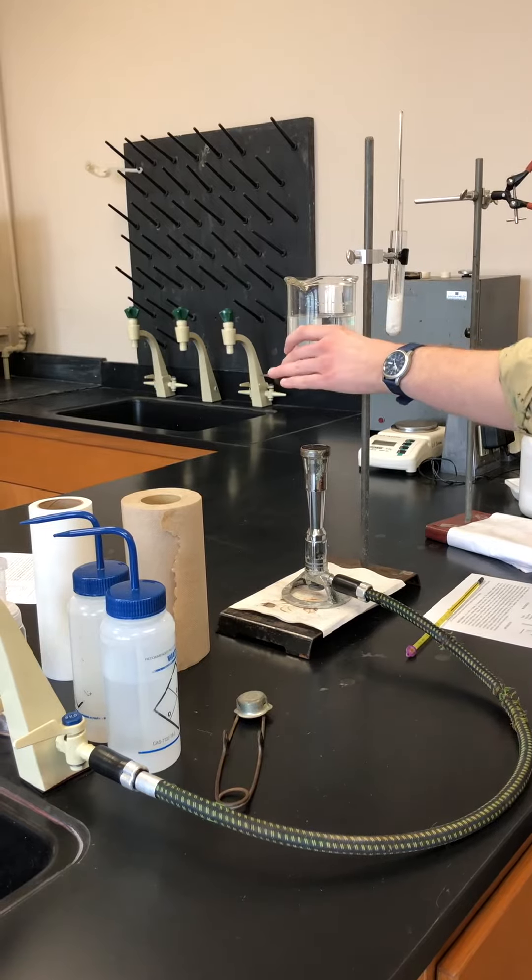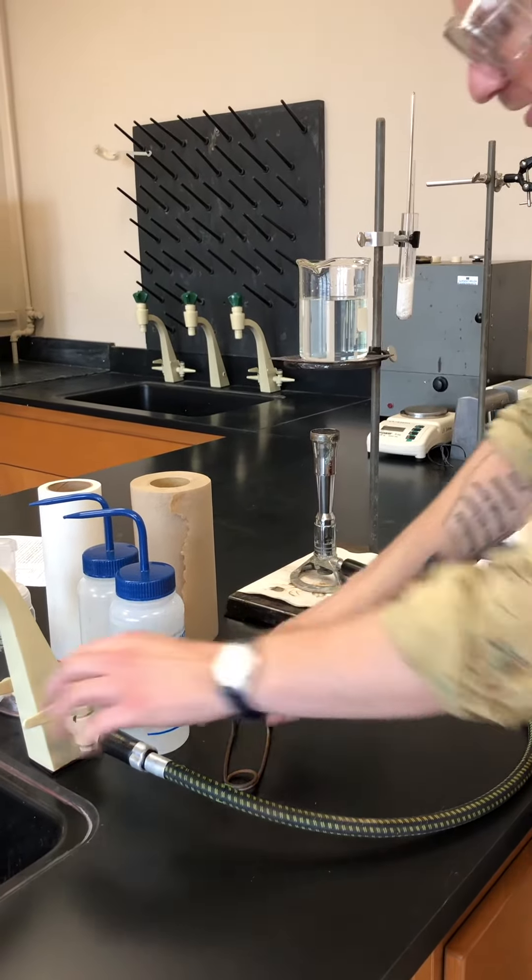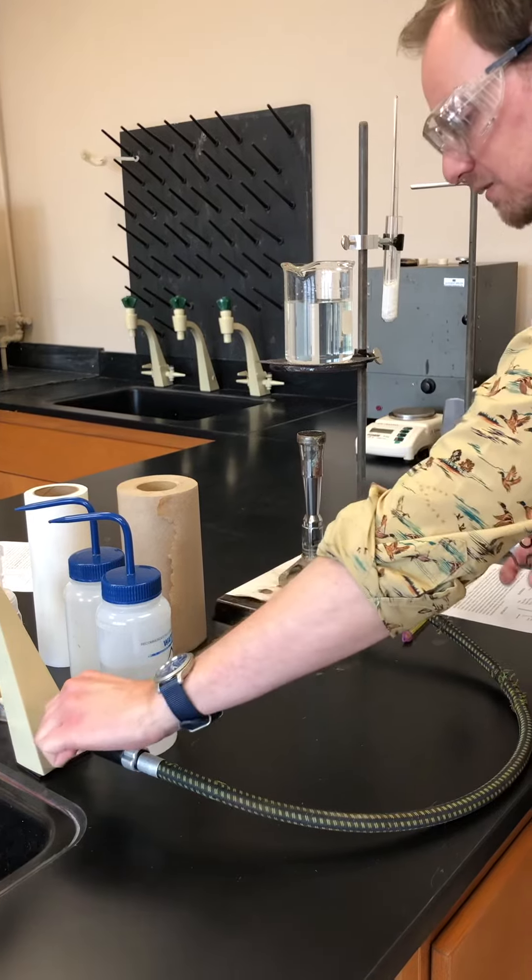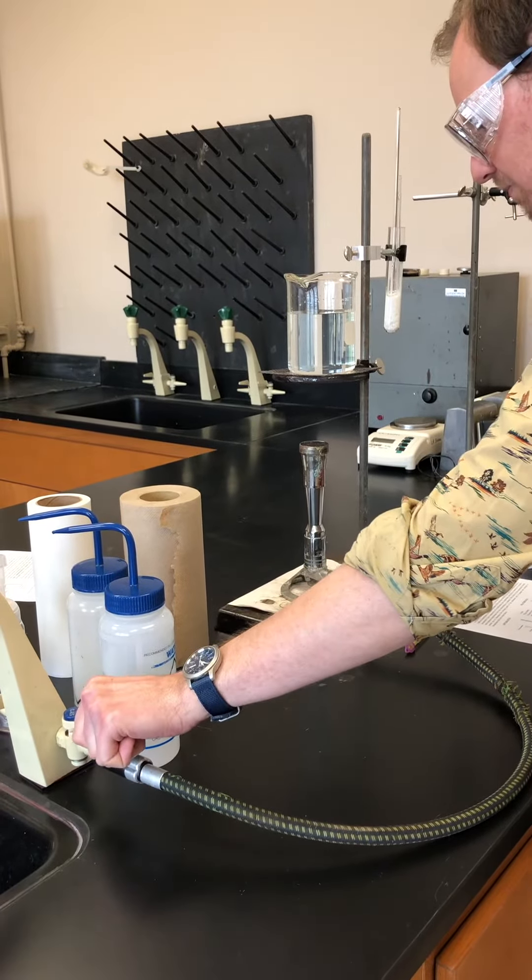So by this point you should all know how to light a Bunsen burner. You've seen it in several of the videos. So we're just going to light this and start heating up our water.